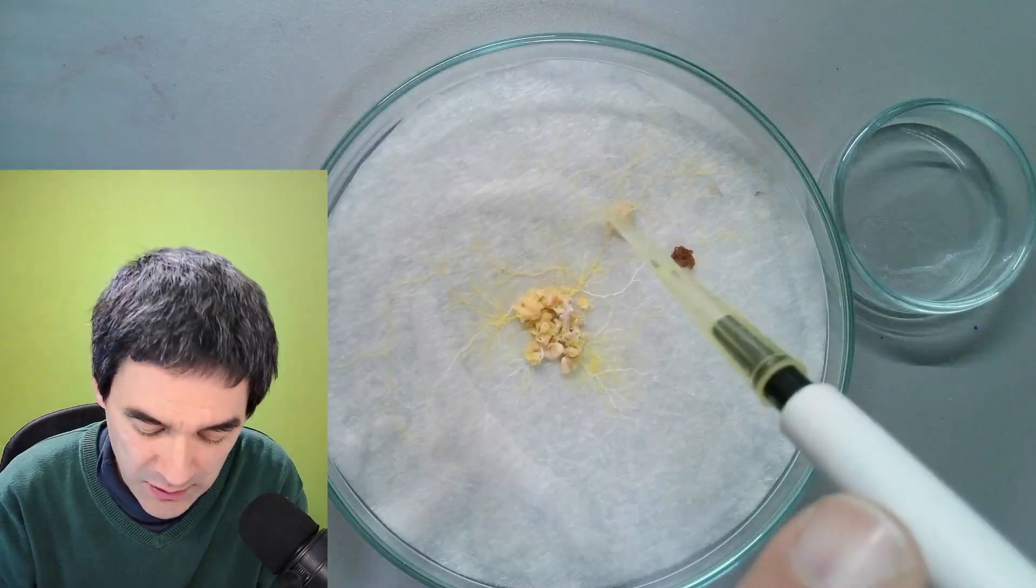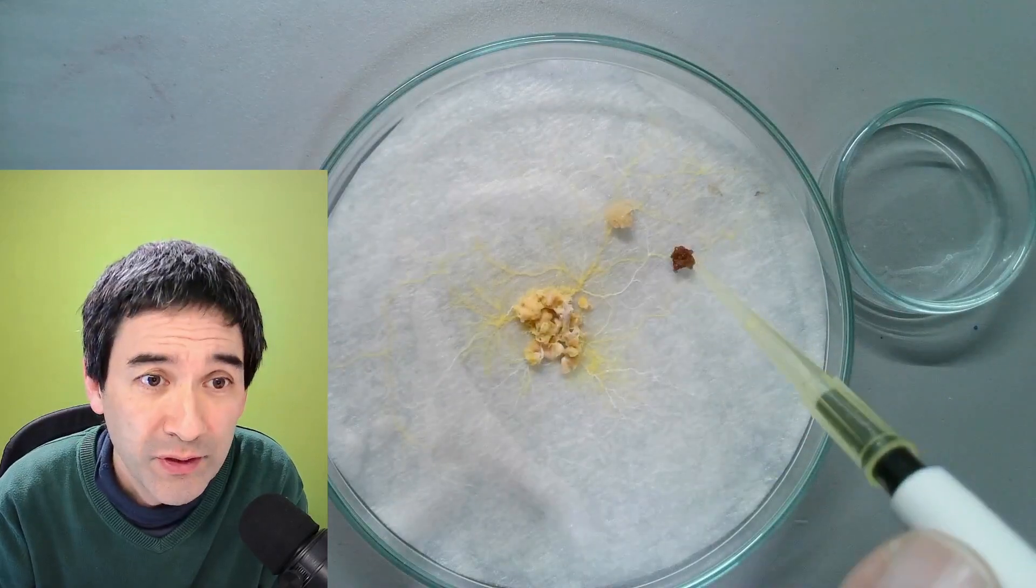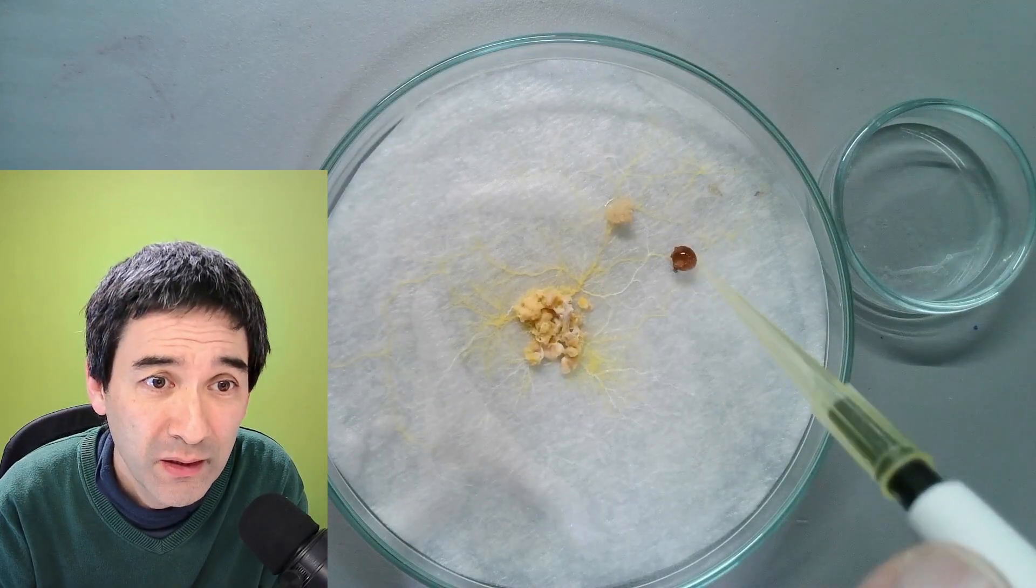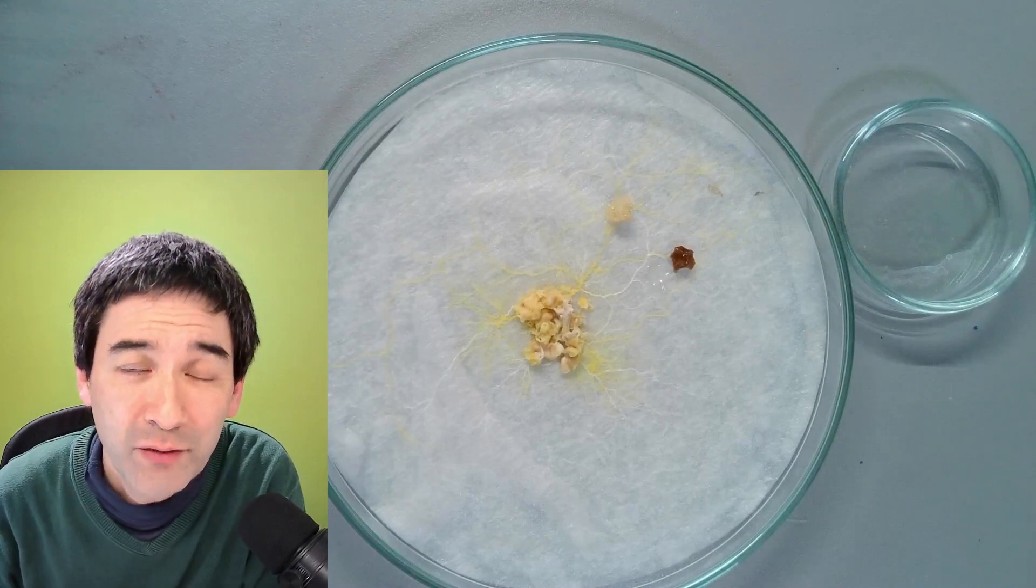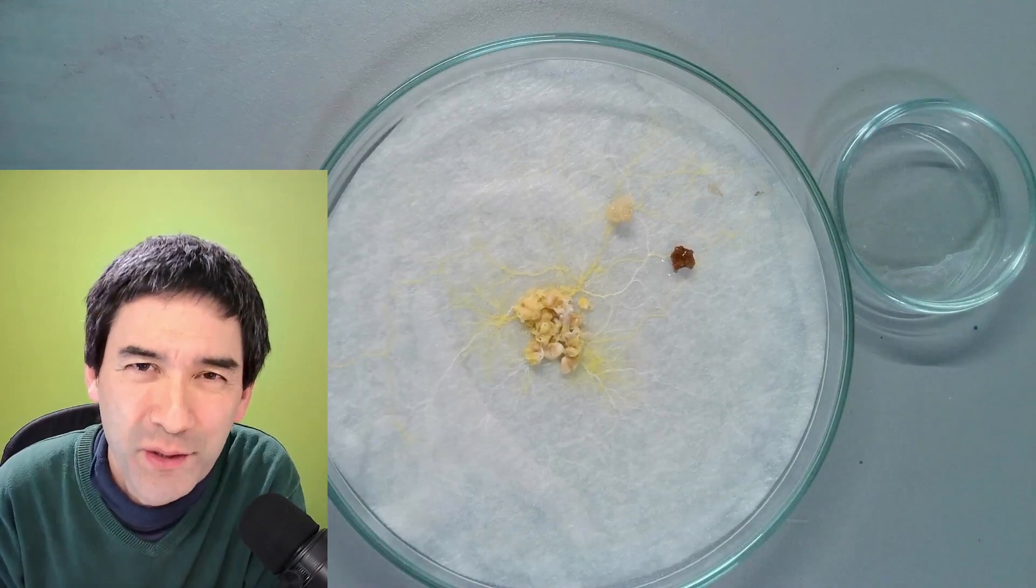But I have to add a little bit of water as well. So a tiny drop of water here and over here as well. I think we're just going to have to be patient now. But let's put it also under the microscope.